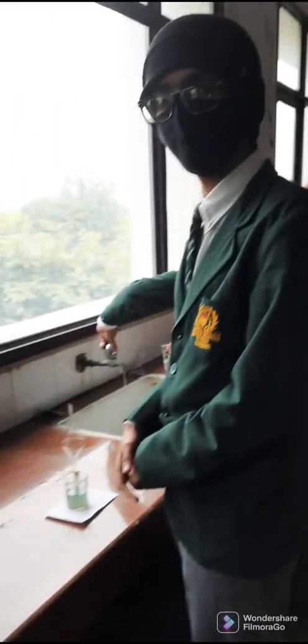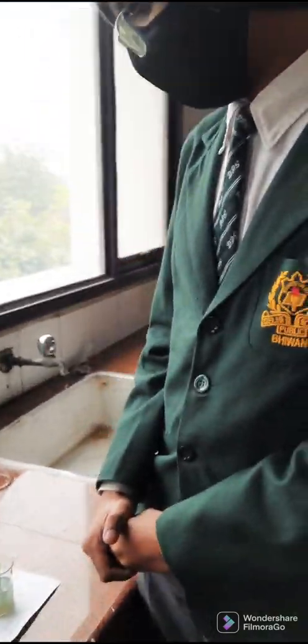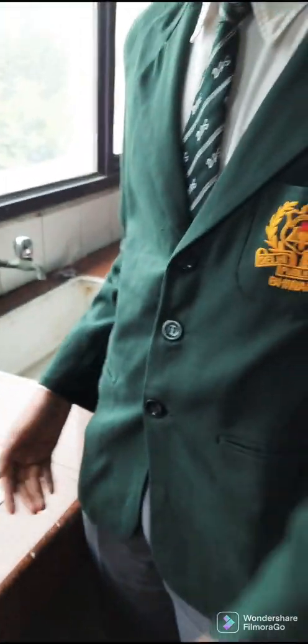Moving to Group 2 — Niketan and Ekta. They have taken soil from the roadside. After filtering, the pH is coming between seven and eight, which means it is slightly basic.